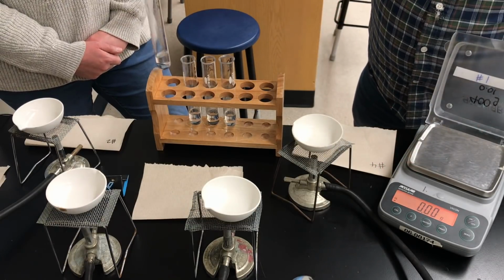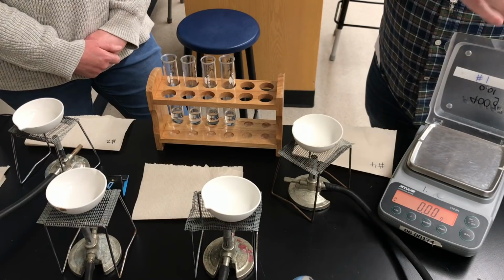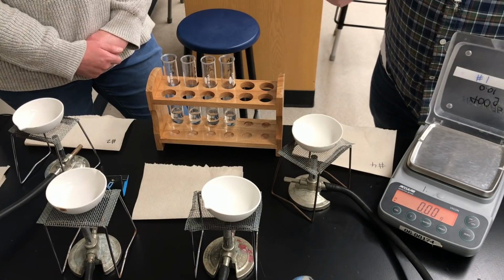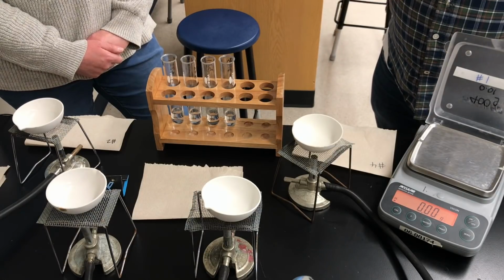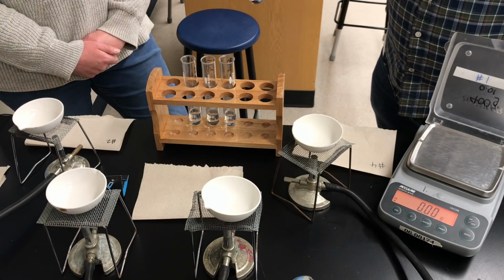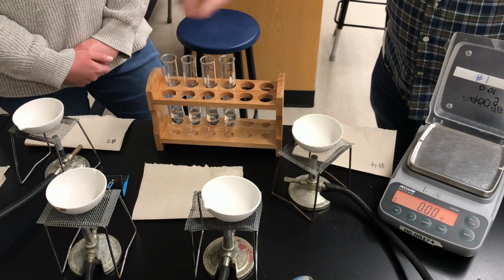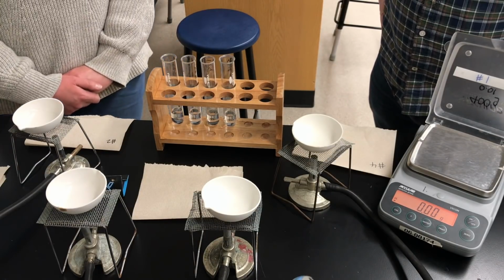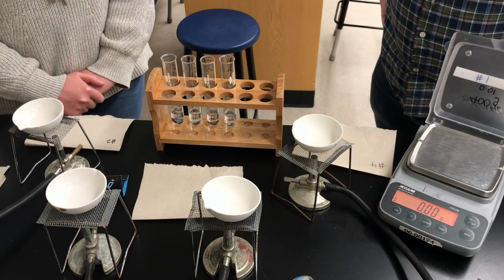So if we have leftover zinc metal, remember we were reacting zinc metal with hydrochloric acid. If you're a grade 11 chemistry student, you would now know which of those 2 reactants was the excess reactant and which one was the limiting reagent. For a grade 9 science student, Ms. Watts, why is it important that we have leftover zinc metal today in terms of the procedure that we're about to do, a safety consideration? So we want to make sure that all of the hydrochloric acid has reacted with the zinc metal. Otherwise, if we were to do our next step and evaporate, we might be evaporating some hydrochloric acid, which would be harmful for us to inhale.